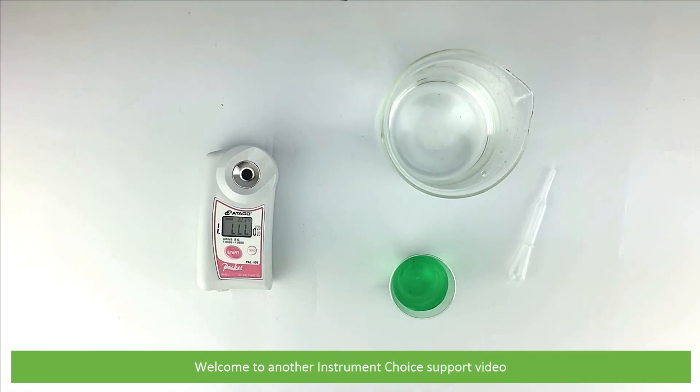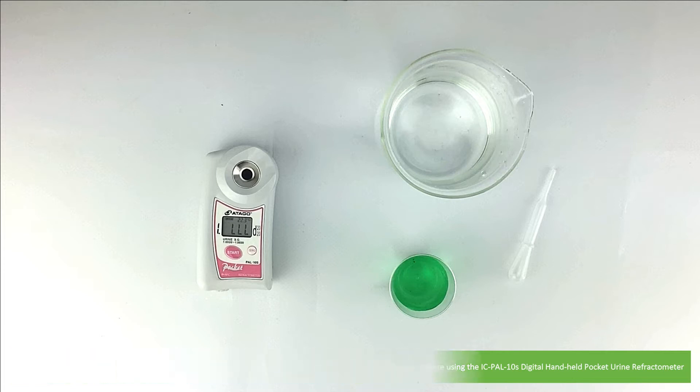Hi and welcome to another Instrument Choice support video. In this video, we'll demonstrate how to use a digital refractometer for urine specific gravity. For this example, we are using the IC PAL-10S Digital Handheld Pocket Urine Refractometer.